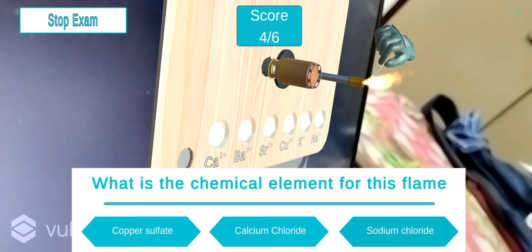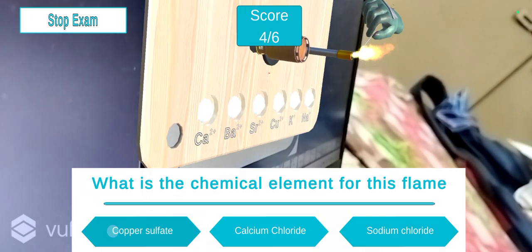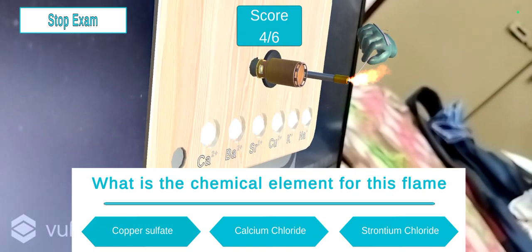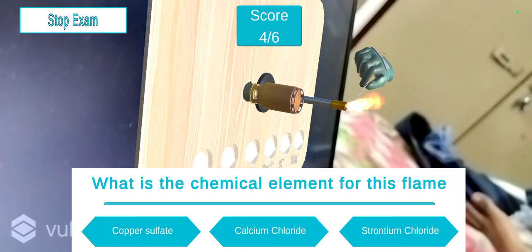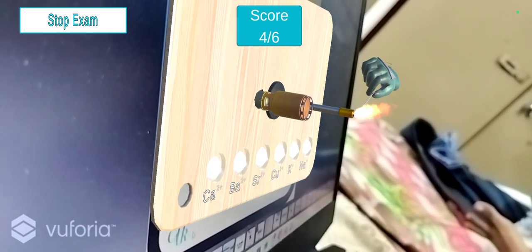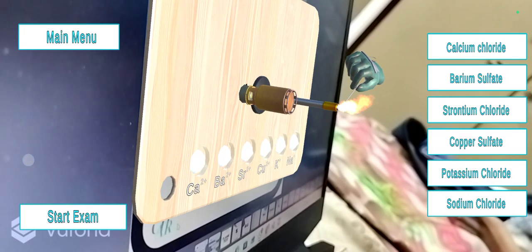Okay, what is the chemical element for this flame? Okay, now I'll type one more wrong answer. So finally you'll get the score of it, and that's the end of the quiz. Just you need to tap stop exam.